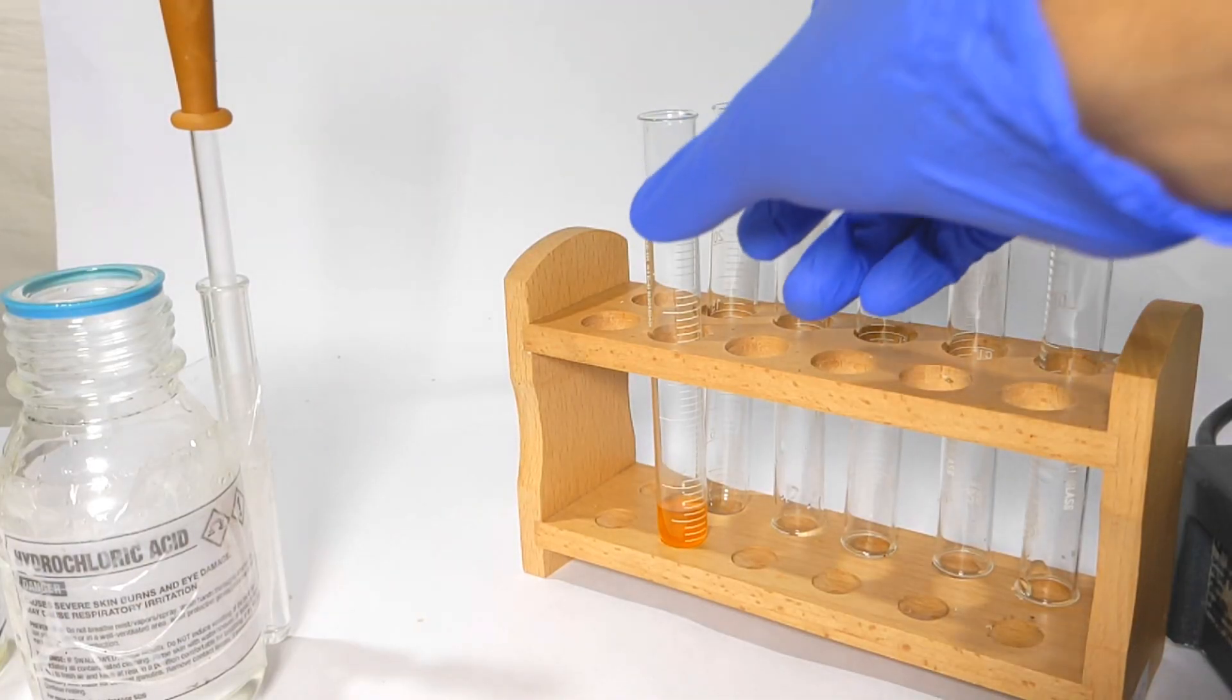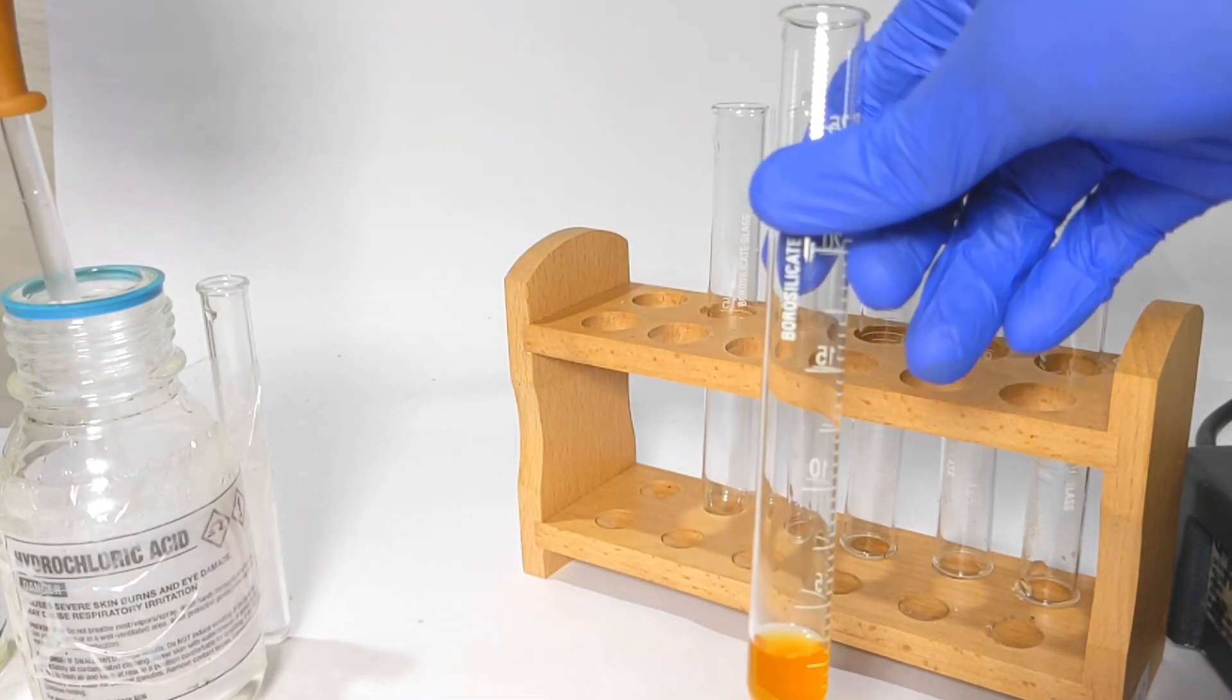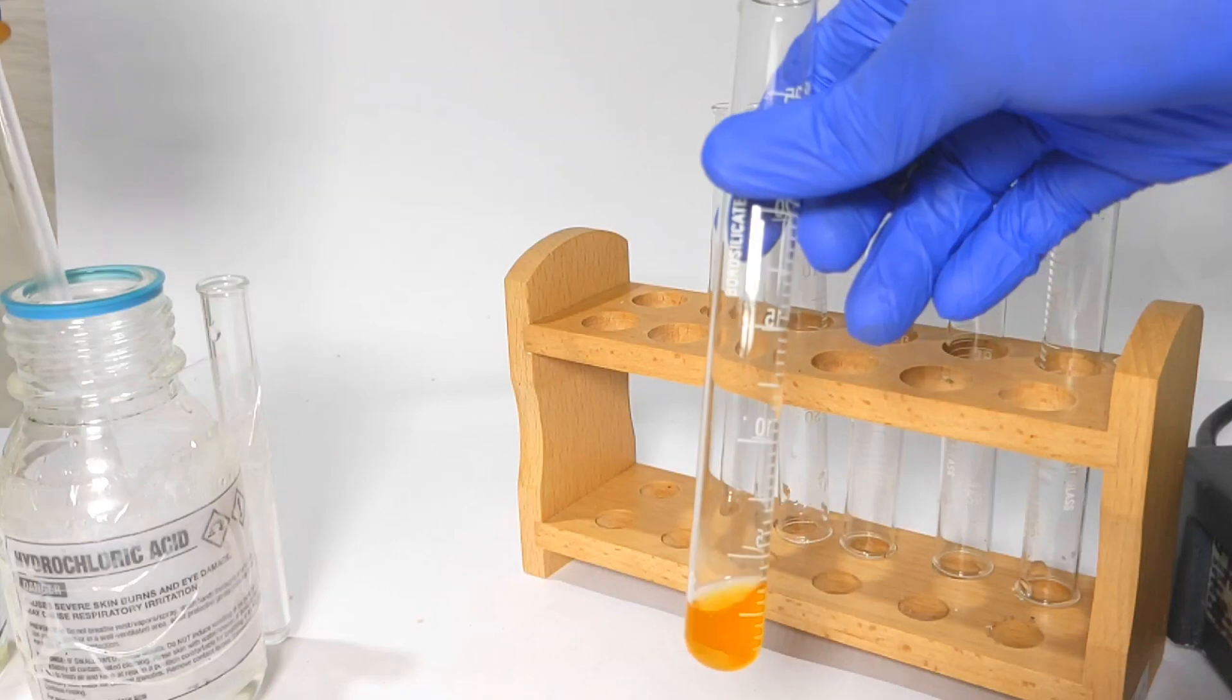After cooling down we add concentrated hydrochloric acid to neutralize the base. And this will form the hydroxamic acid in situ in the test tube.